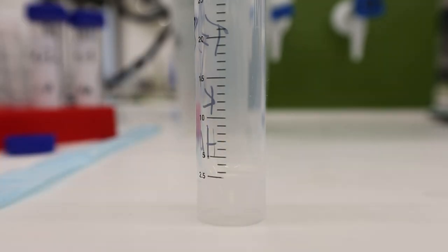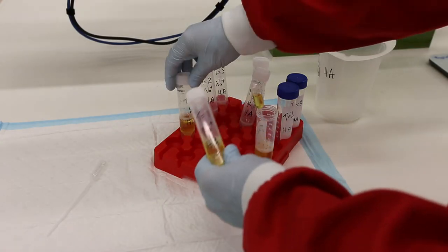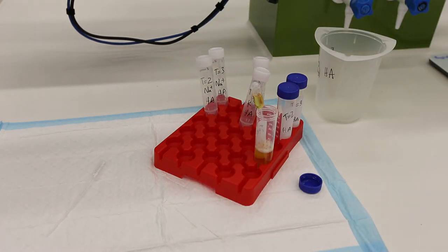Once you have done this, repeat the process for the second tube. These two tubes will be used to measure the concentration of sodium and potassium, while the remaining sample in the 50 ml falcon tube will be used to measure osmolality and pH.